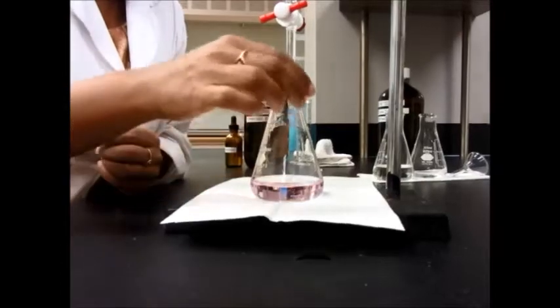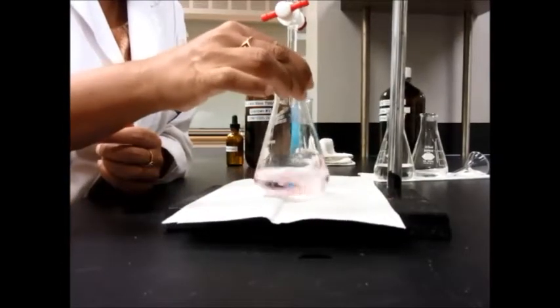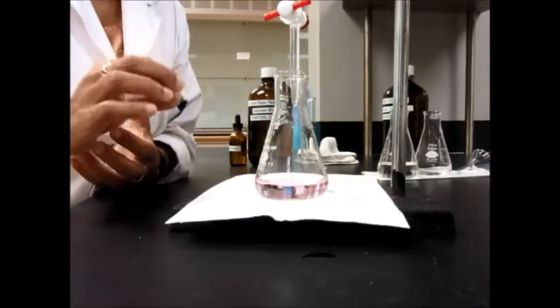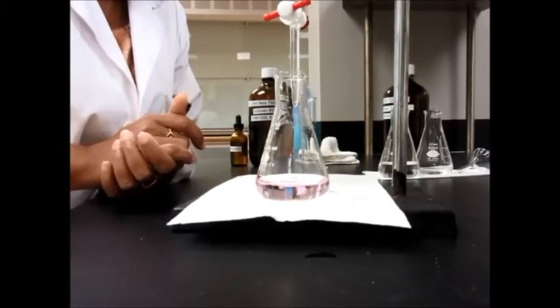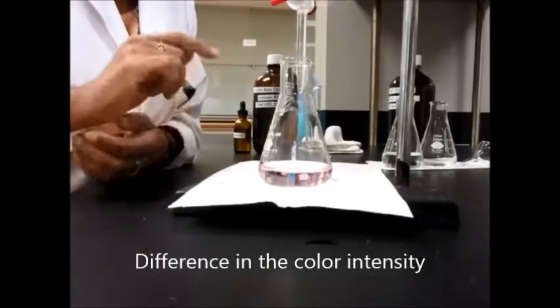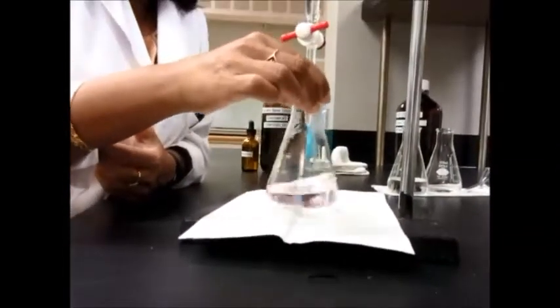If the pink stays, your titration is done. If it disappears, you can add one more drop. The problem with this acid-base titration specifically is that even one drop can make a huge difference, so you want to be careful.